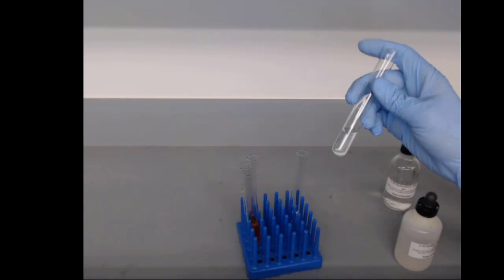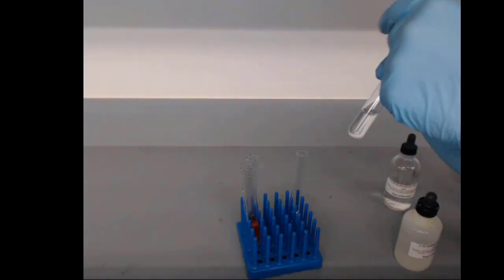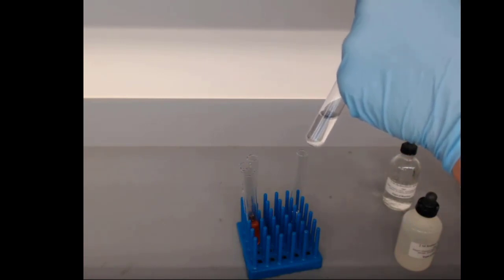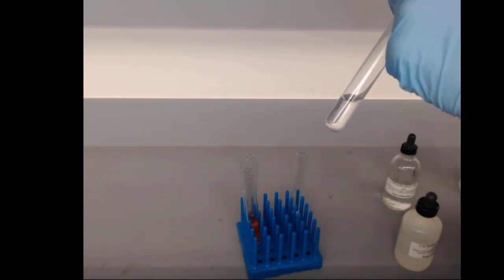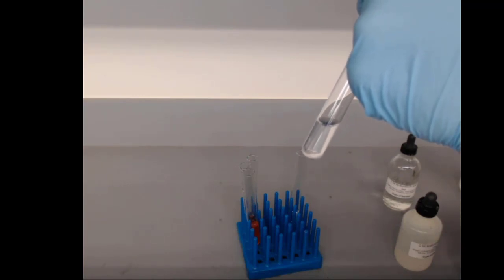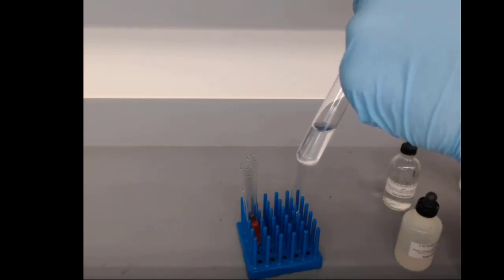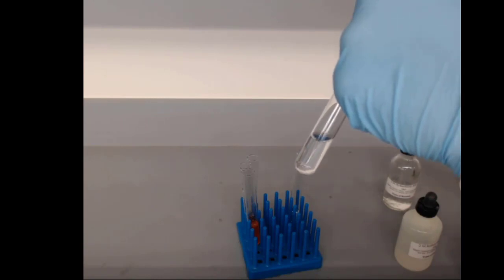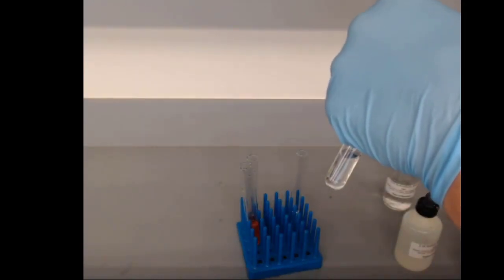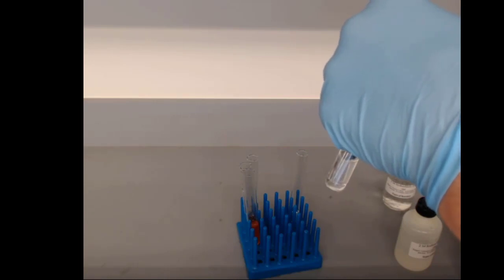For our acetic acid, we'll go ahead and use phenolphthalein. This is the typical indicator we use for most acid-base reactions, unless we want a very particular change. But in a lot of situations, phenolphthalein works really well. So I'll just put in 2 drops of phenolphthalein, not trying to overdo it like I did last time.